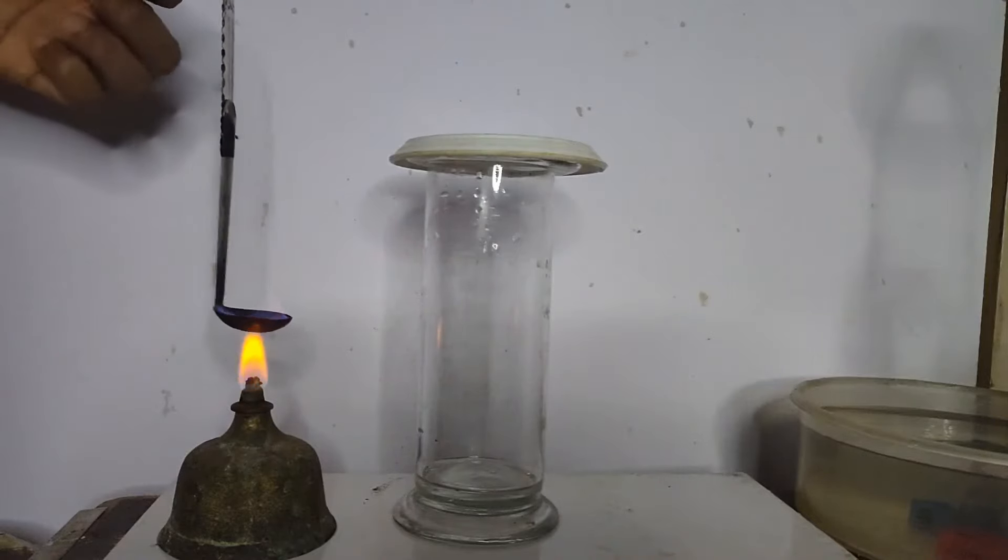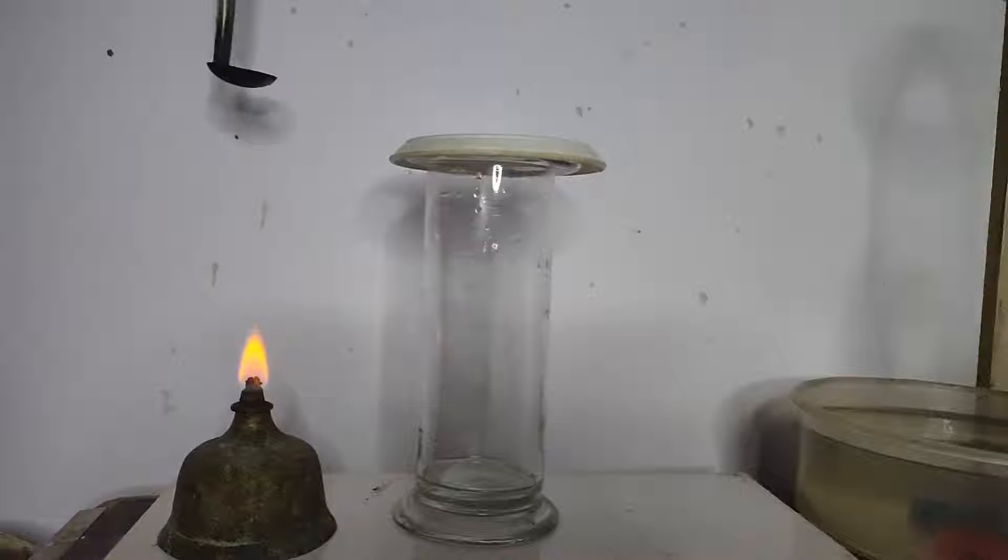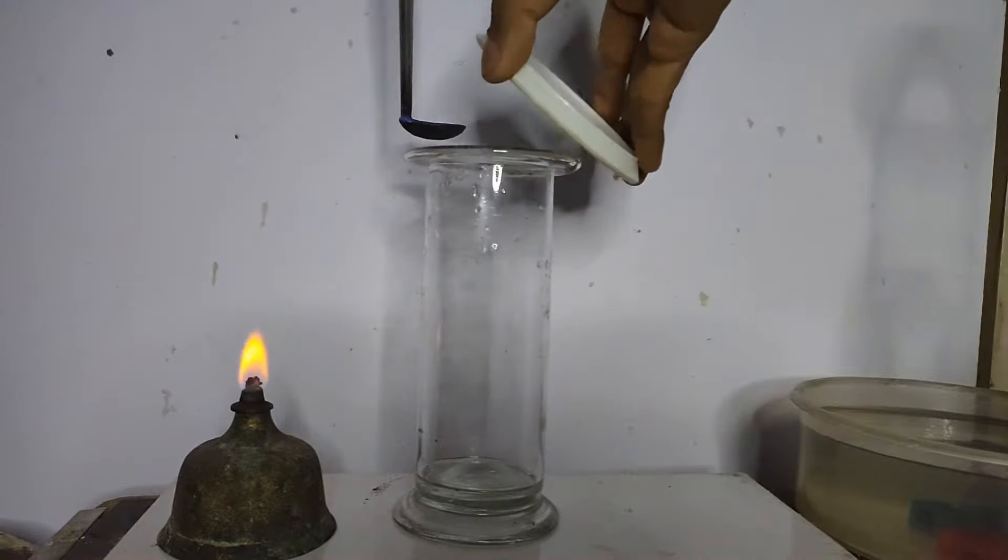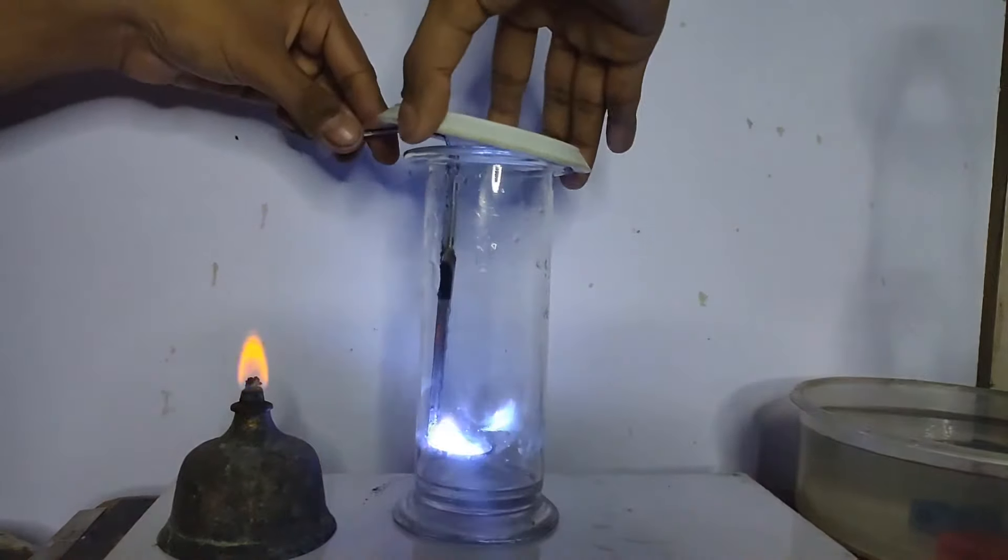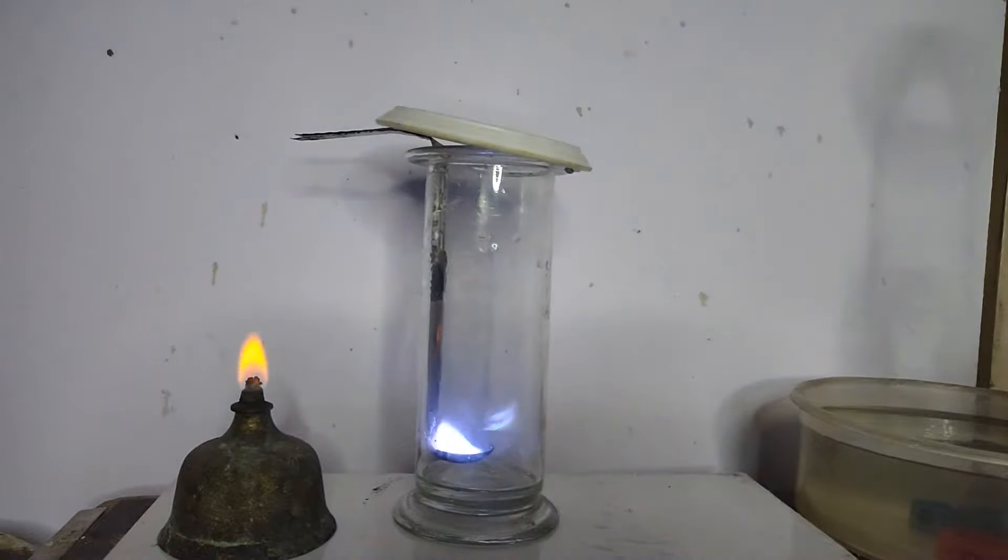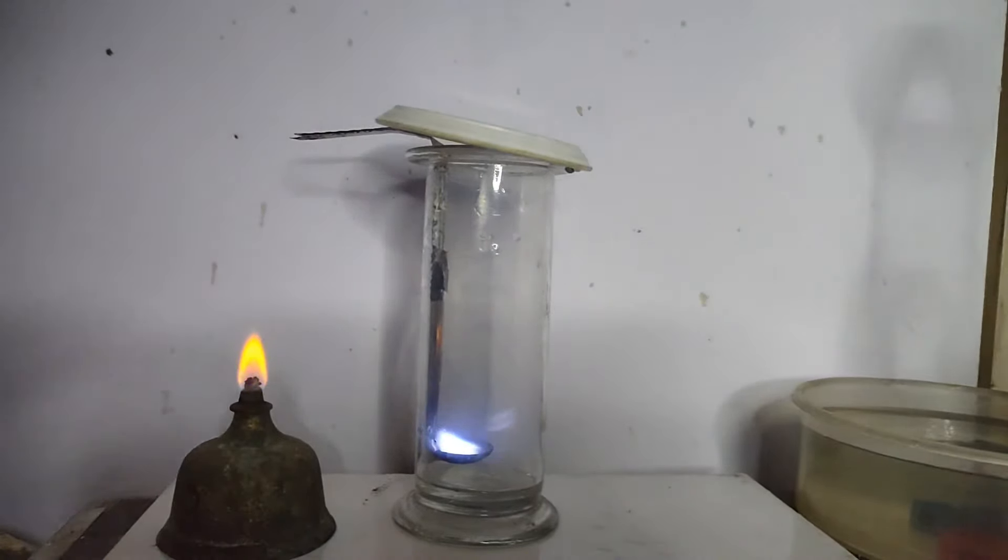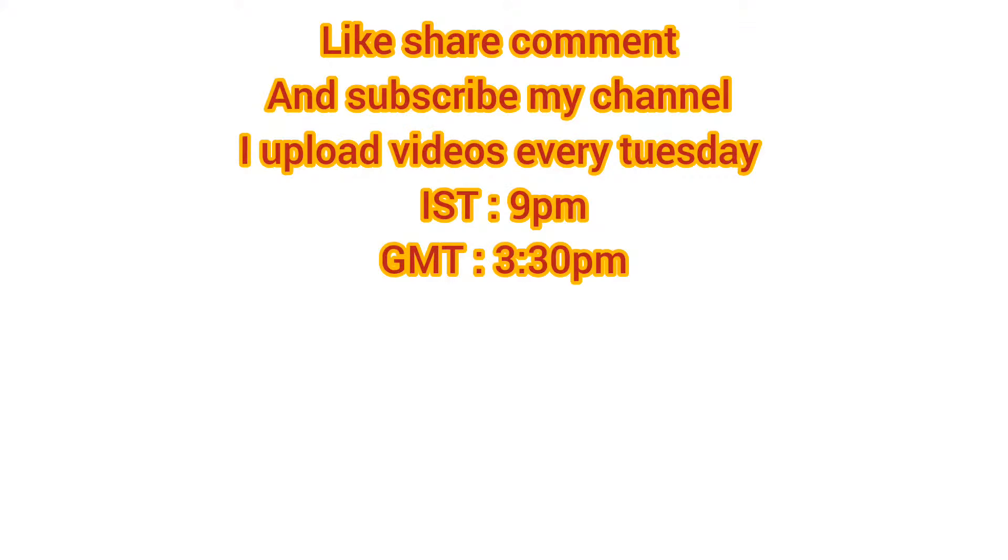Now again I am demonstrating you the same experiment, sulphur burning in pure oxygen.